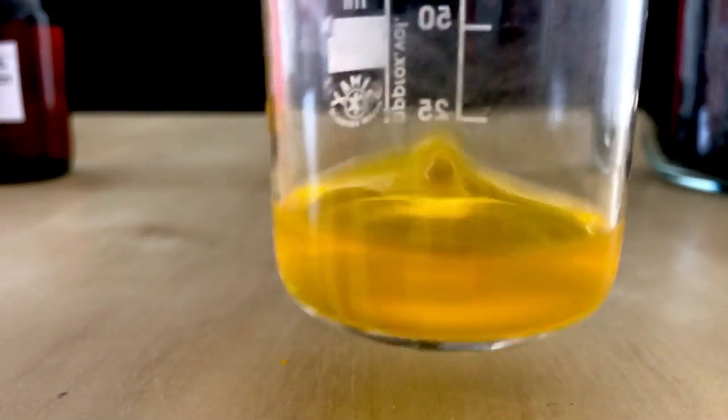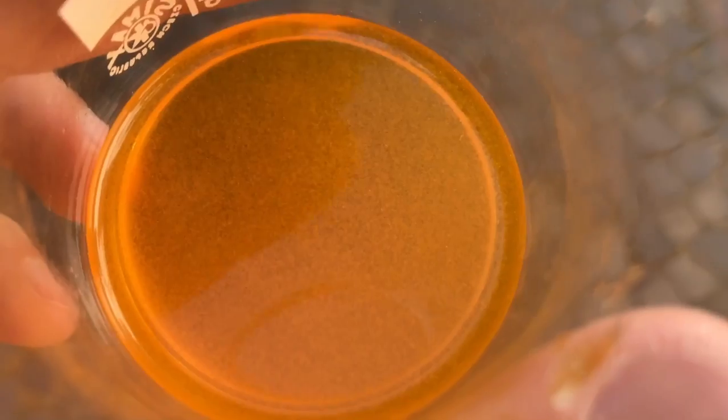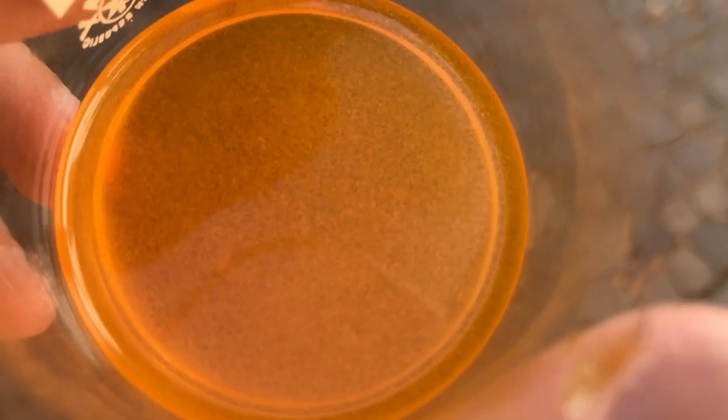I ended up adding a little more of the reagent off camera to make the solution look more orange. After the 10 minutes the solution looked like this. As you can see a precipitate formed.